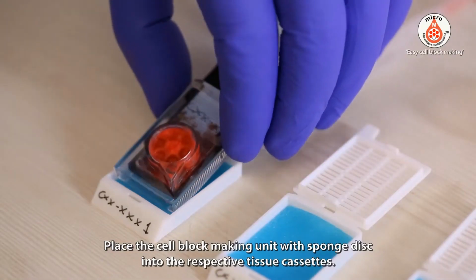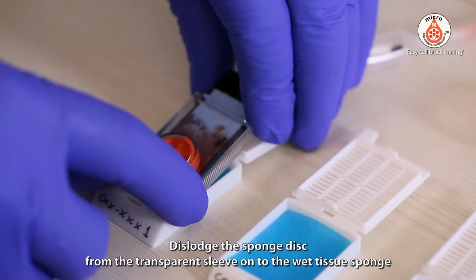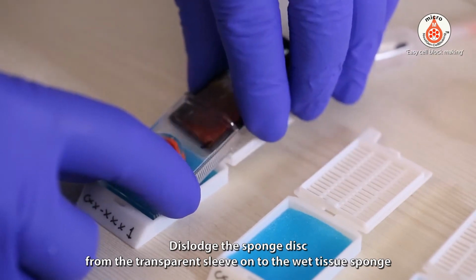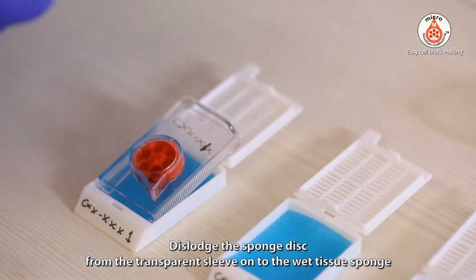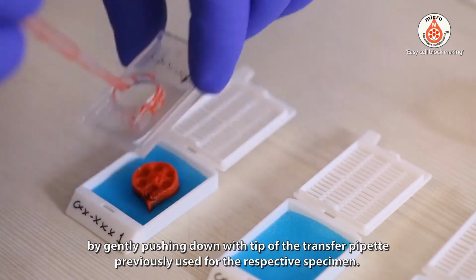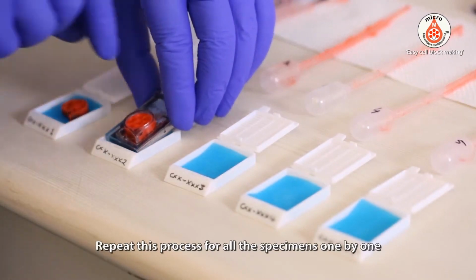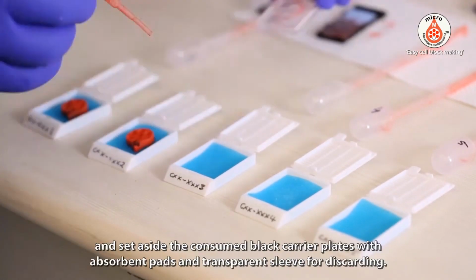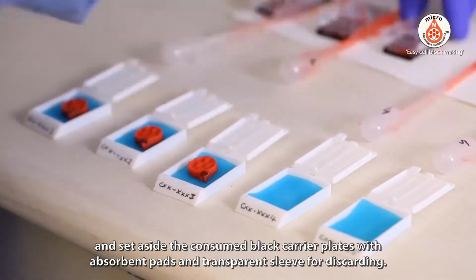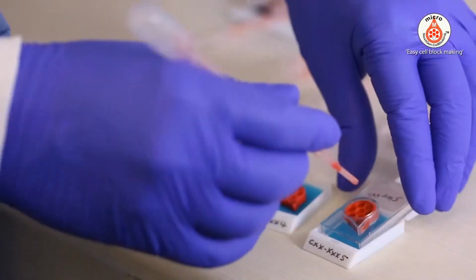Place the cell block making unit with sponge disc into the respective tissue cassettes. Dislodge the sponge disc from the transparent sleeve onto the wet tissue sponge by gently pushing down with the tip of the transfer pipette previously used for the respective specimen. Repeat this process for all the specimens one by one, and set aside the consumed black carrier plates with absorbent pads and transparent sleeve for discarding.